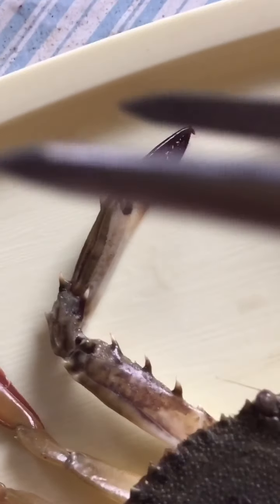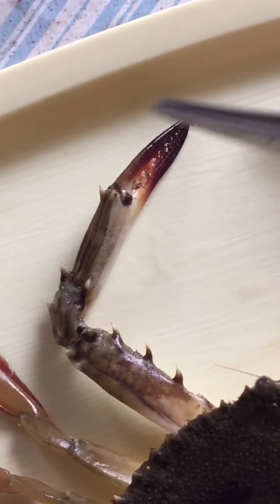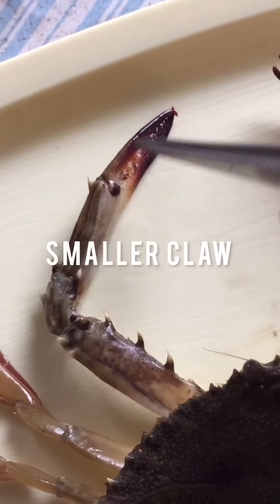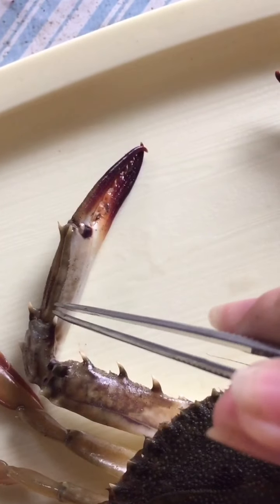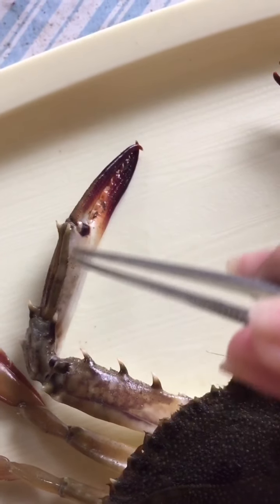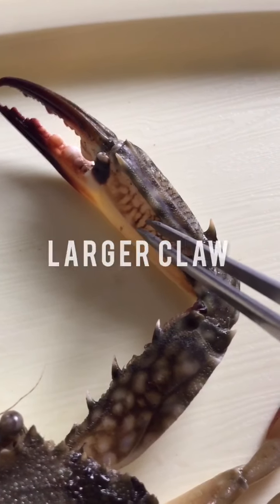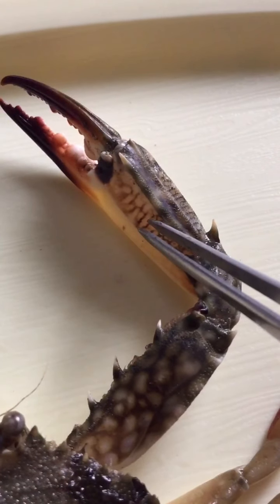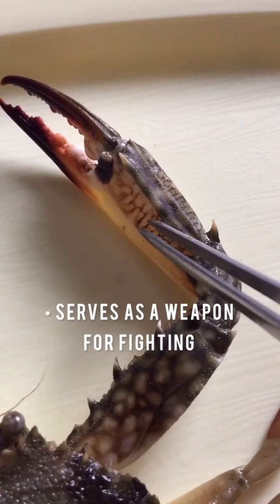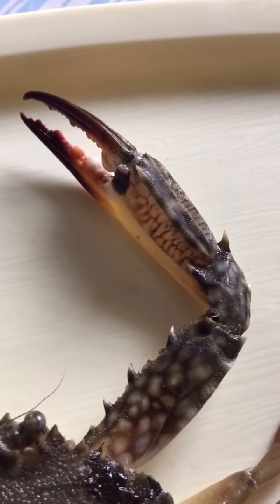Let's go to the crab claws — the smaller and larger claws. This one is the smaller claw, which is used for feeding. And the larger claw is used to attract partners for mating and to threaten other crabs as a weapon for fighting.